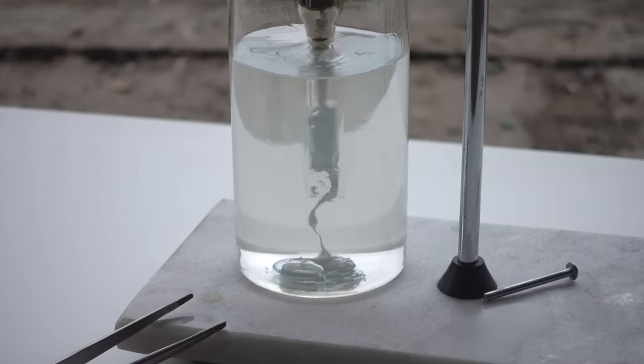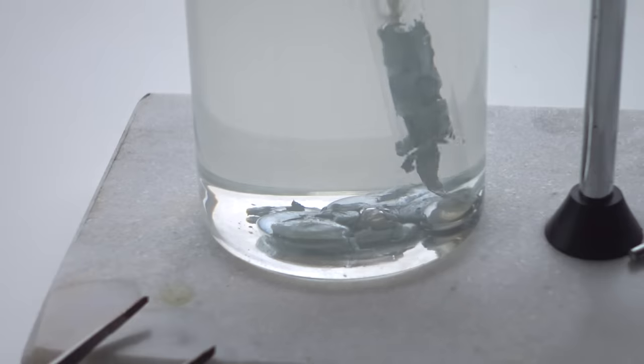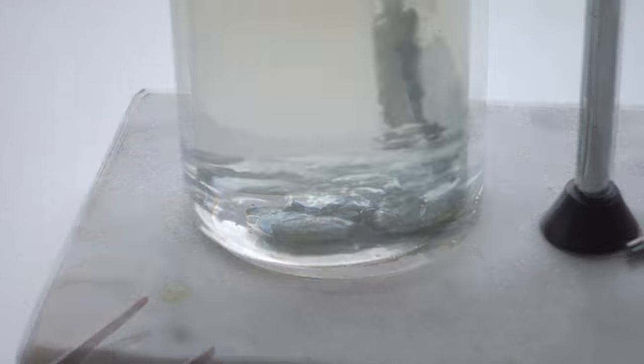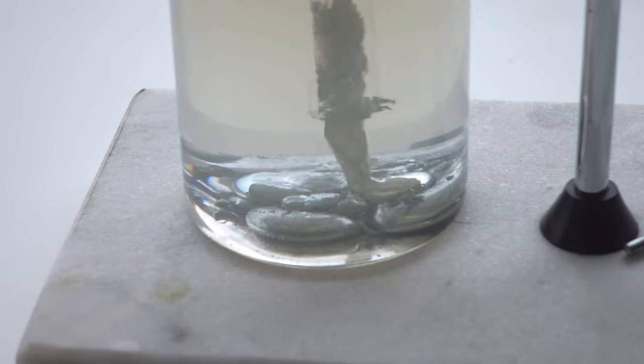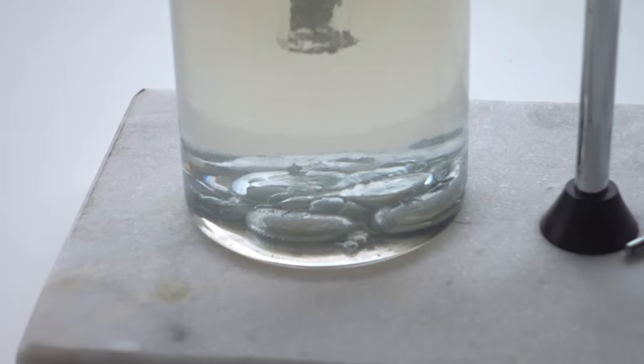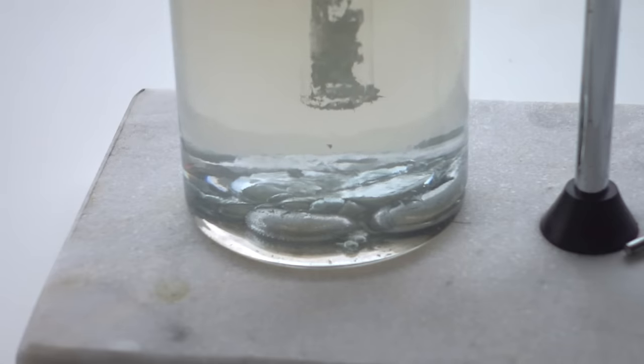Gradually, the liquid cesium began to flow from the vial into the kerosene, after which it immediately lost its golden shine and got covered with a layer of oxides and peroxides, due to the impurity of water and oxygen in kerosene.